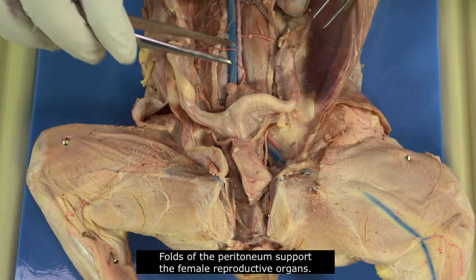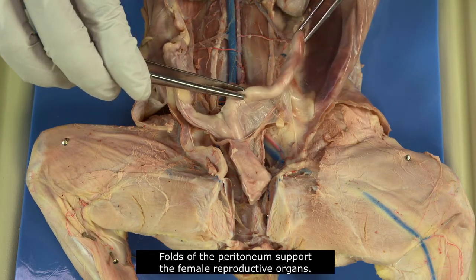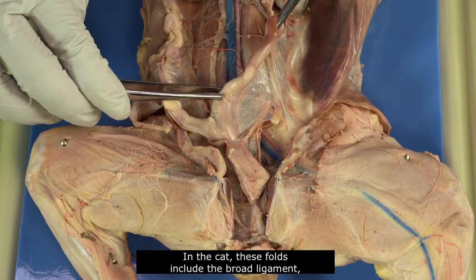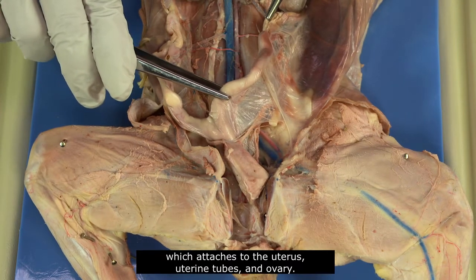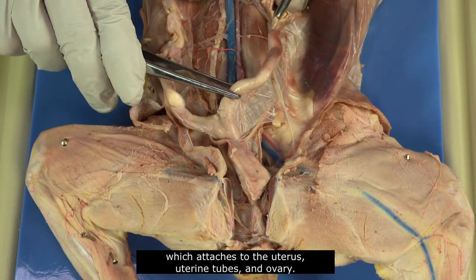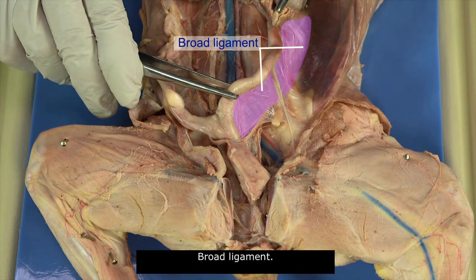Folds of the peritoneum support the female reproductive organs. In the cat, these folds include the broad ligament, which attaches to the uterus, uterine tubes, and ovary, the broad ligament.